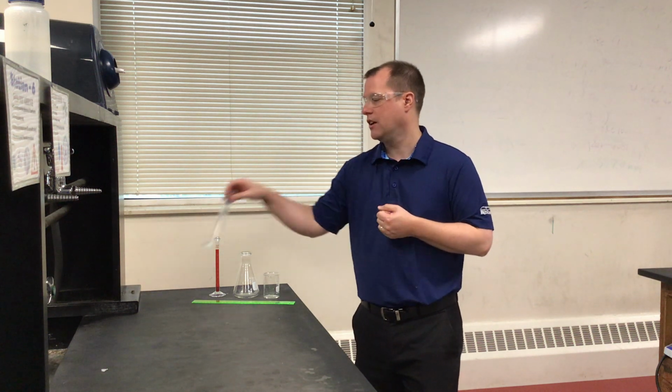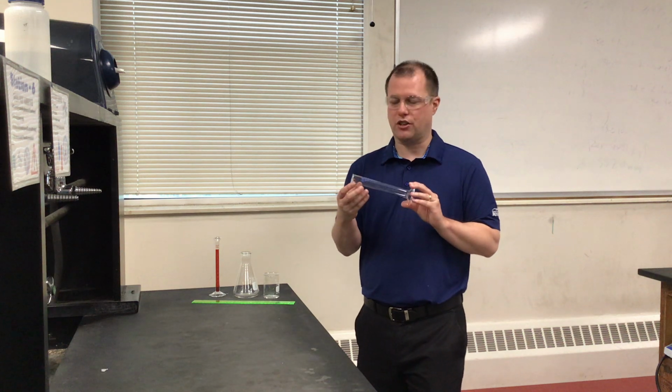What we're going to be taking a look at today is a couple different measuring devices and how we actually apply significant figures to making measurements in a laboratory setting, ranging from things like a ruler, making measurements of length, to measuring volume with some different tools that I have here in forms of glassware, such as graduated cylinders, which are going to be a little bit more precise.